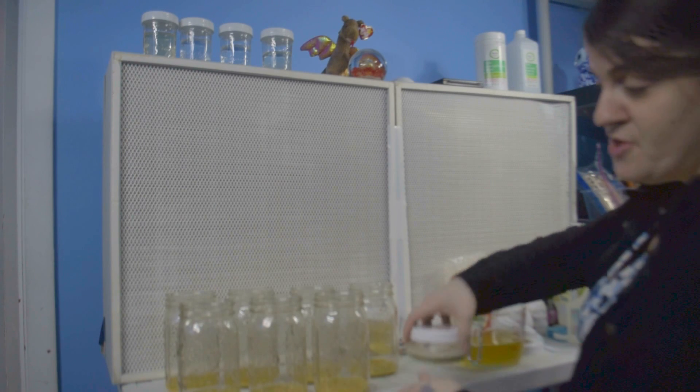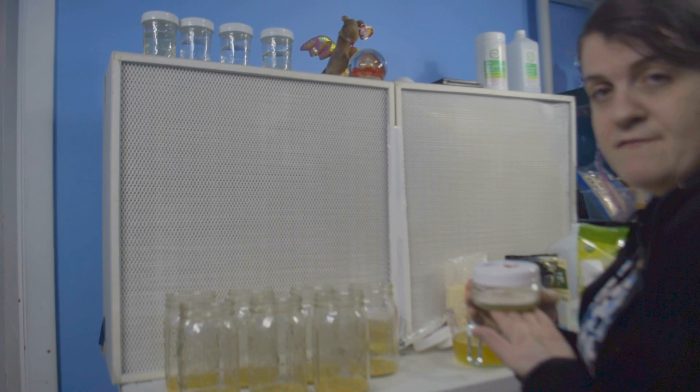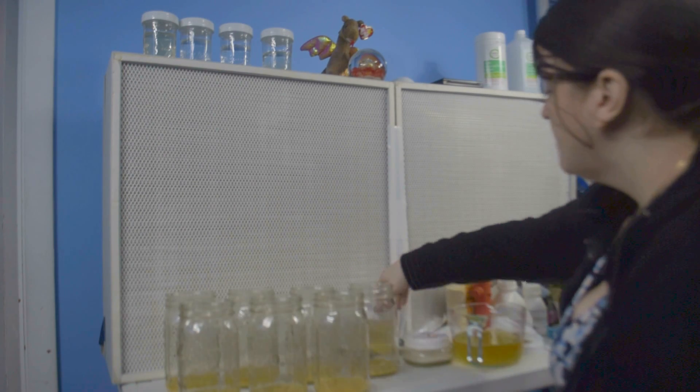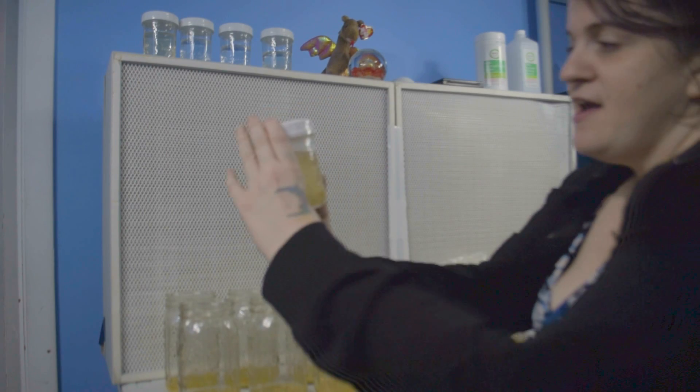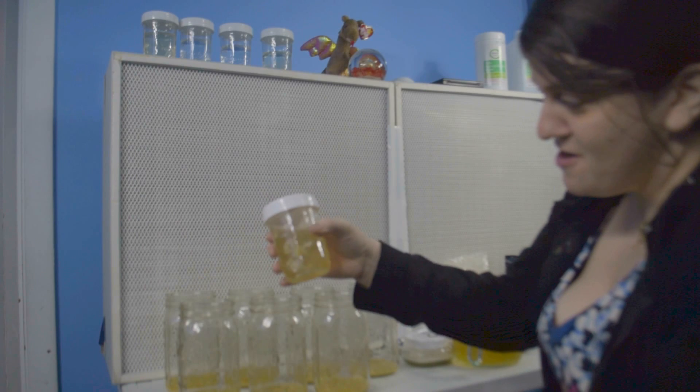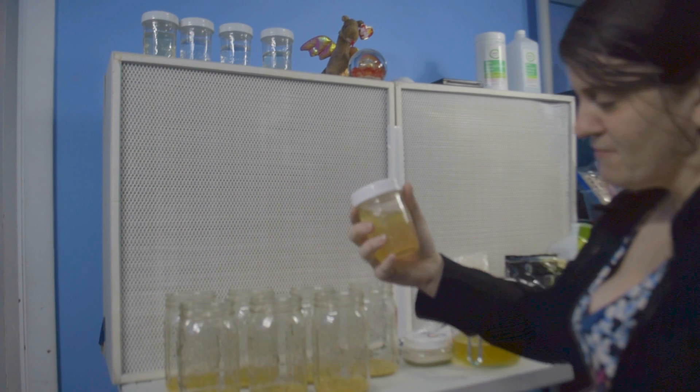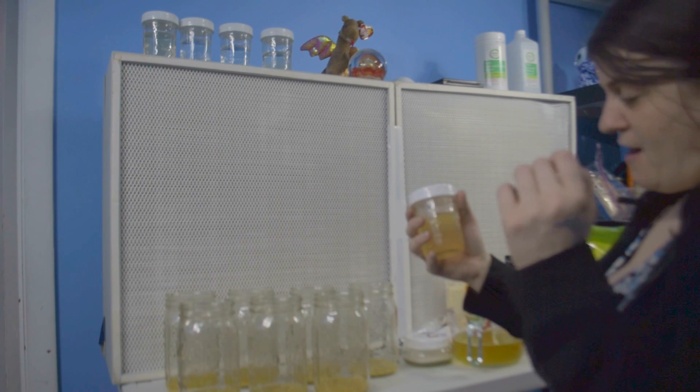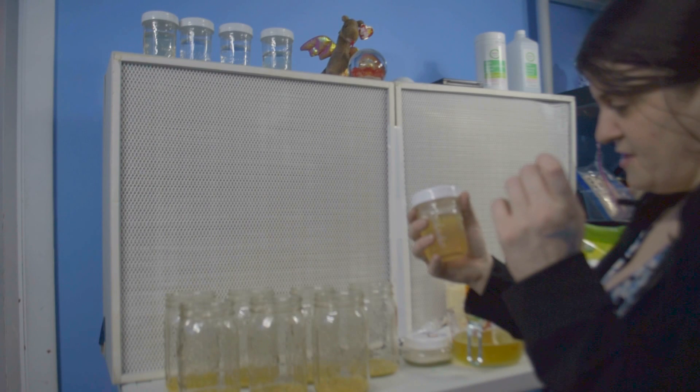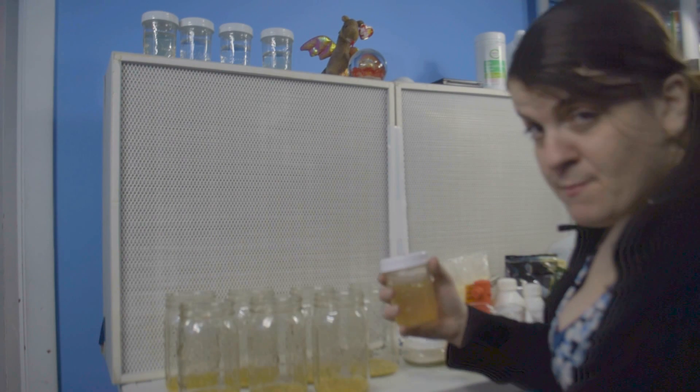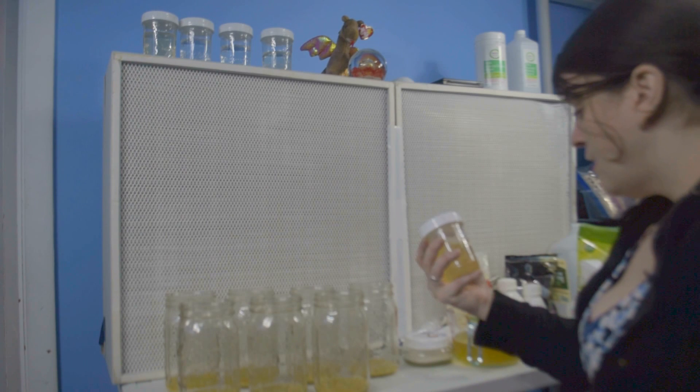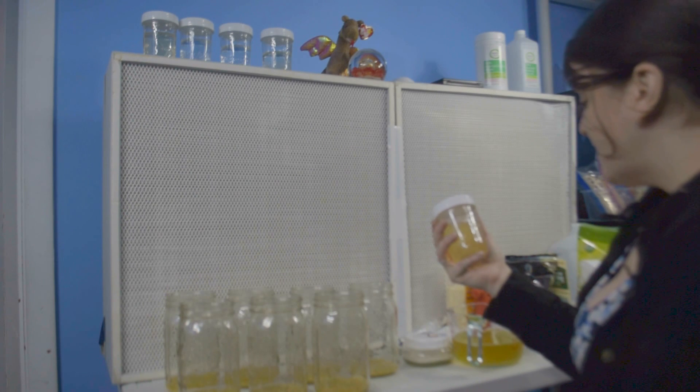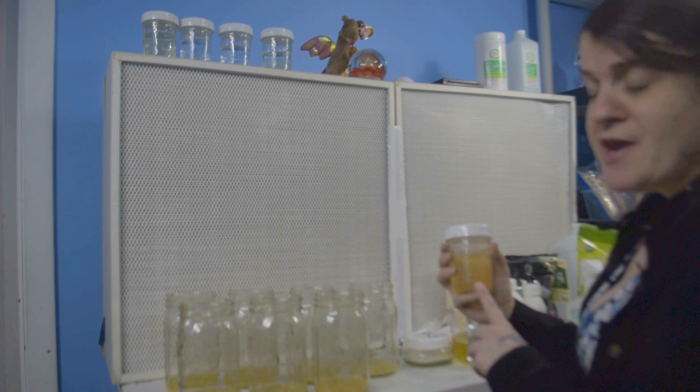So I'm going to do some of these jars up with this plate that I have here. I have several other plates in the back, but this is a really nice plate. And I have this culture here and I know it looks nuts in there because I did not realize that this Cordyceps, its growth is so rapid and I'm very new to making liquid cultures. So this culture kind of bred out of control because there were too many nutrients in here.